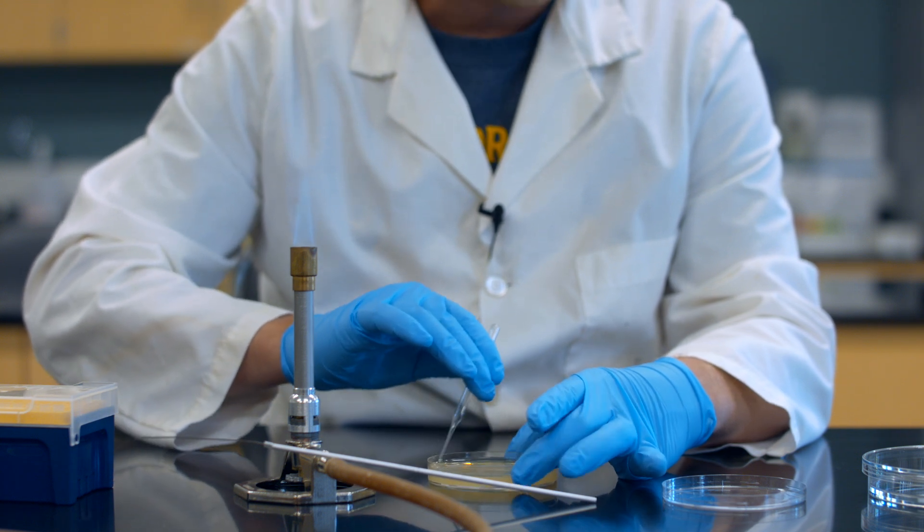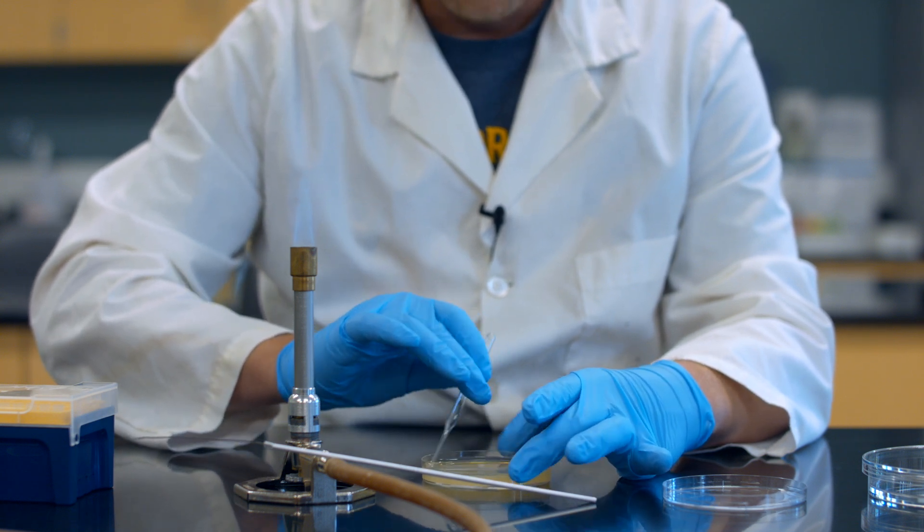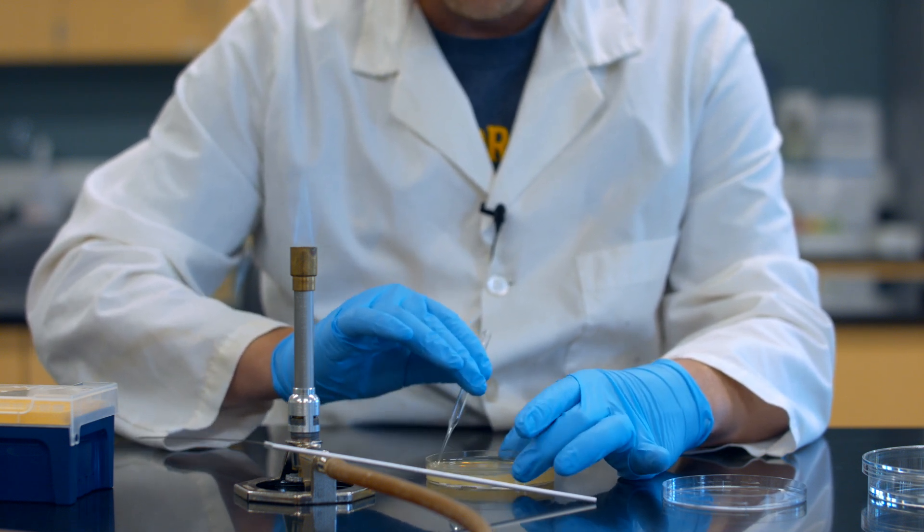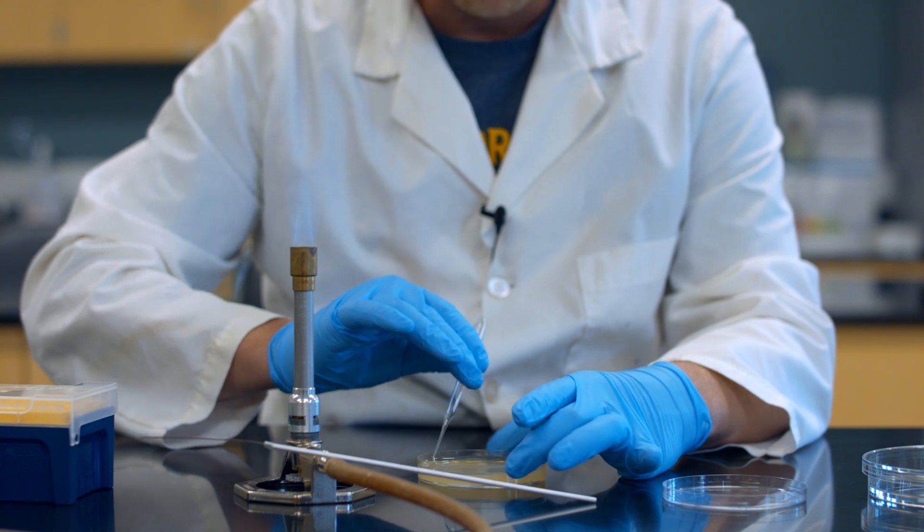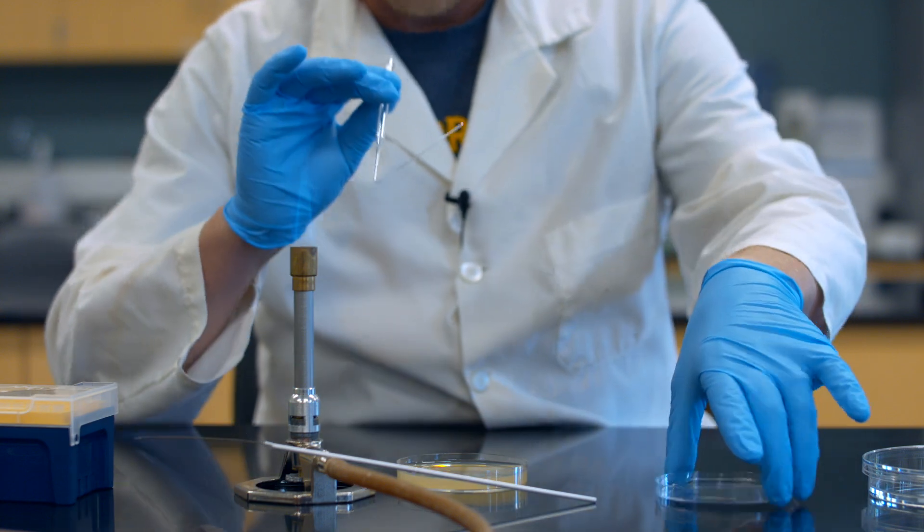How do I know when it's done? Well, that 50 microliters of liquid needs to absorb into the agar. And when I feel my glass spreader starting to drag across the surface, then I know that it's absorbed all it's going to absorb. I can feel it right now, so I'm going to go ahead and stop.